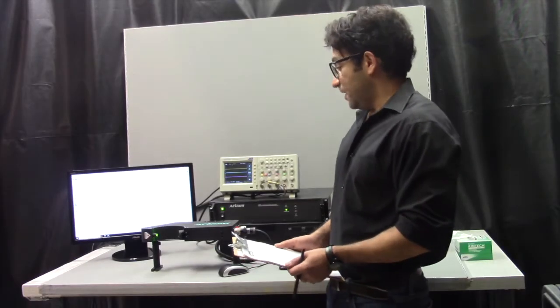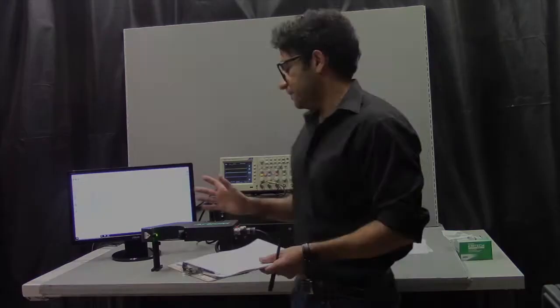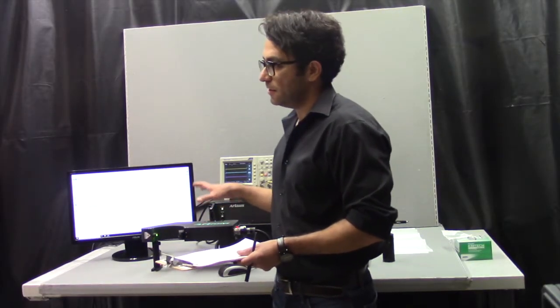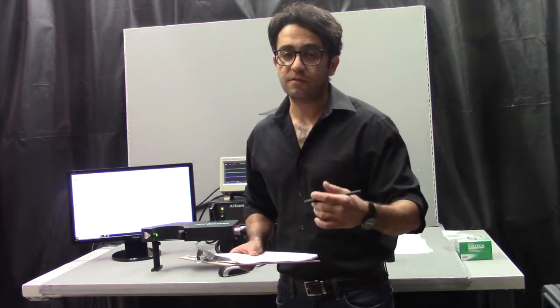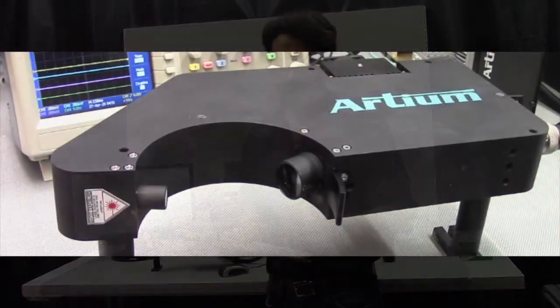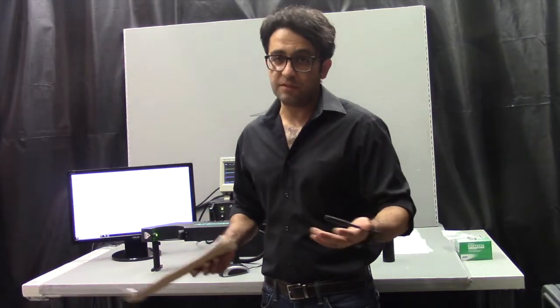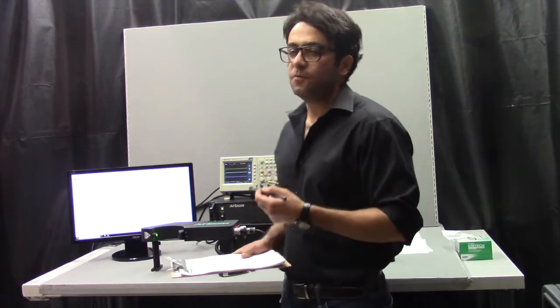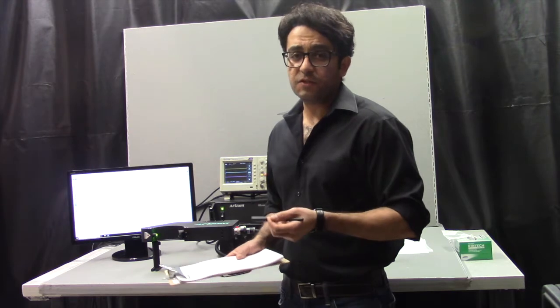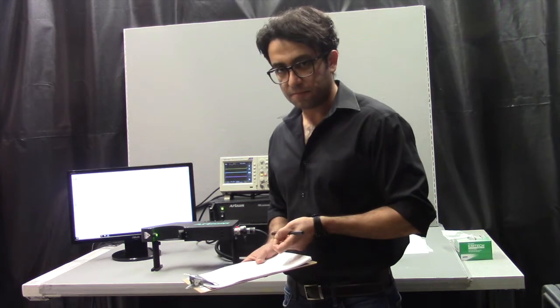What I'm going to explain today is how one of our systems, called TK, works. The difference from this PDI is that in this one, the transmitter that shoots the laser out and the receiver are contained in one package, as opposed to two separate modules. Therefore, it doesn't require any alignment. We align it here in the factory and ship it to you, and you can turn the key and start using it. The TK is a 1D system. It means that it measures the size of the droplets and also one component of velocity.